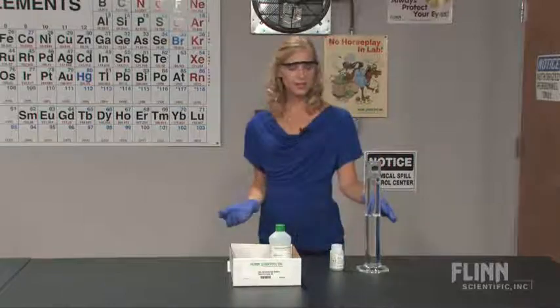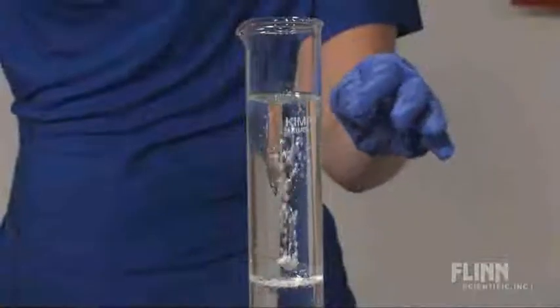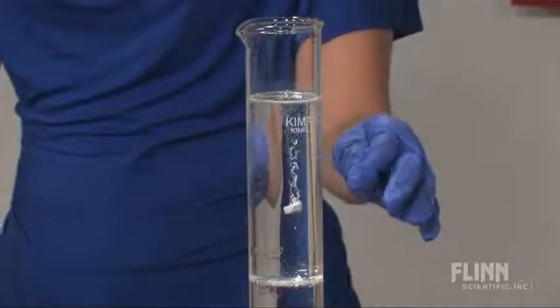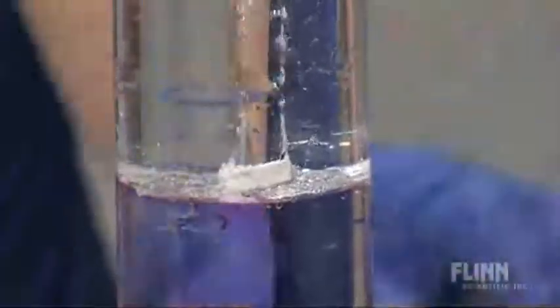Mineral oil is used along with an aqueous water layer, so when you drop the piece of sodium in, it falls through the mineral oil layer, reacting at its interface with the water. It produces hydrogen bubbles and sodium hydroxide.